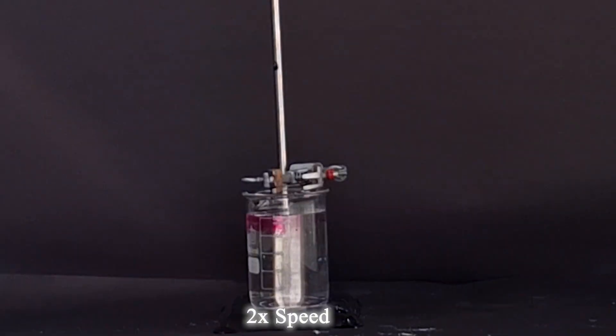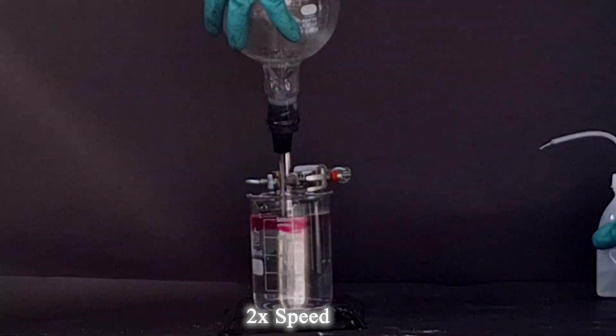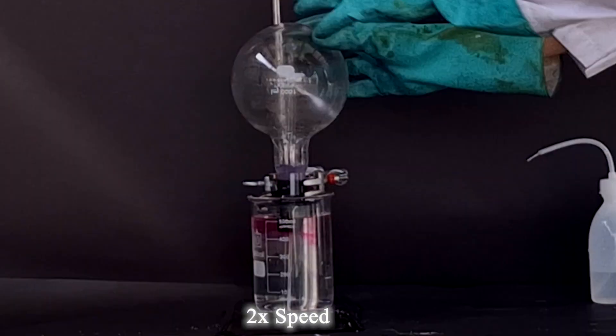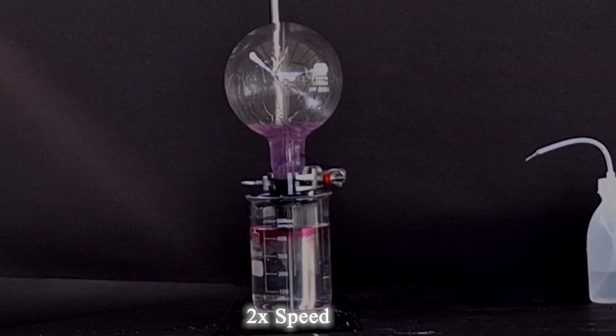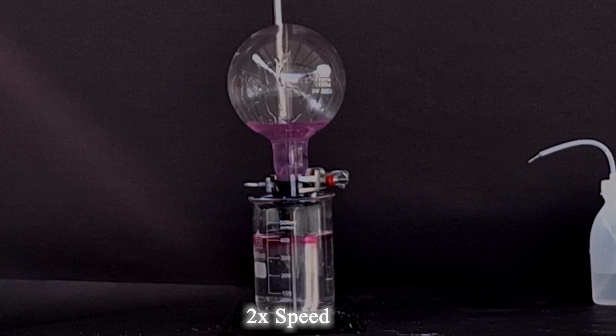Initially, the reaction was nowhere in sight. However, after squirting a bit of distilled water into the flask, we can observe that the beautiful demonstration of ammonia solubility in water has begun.